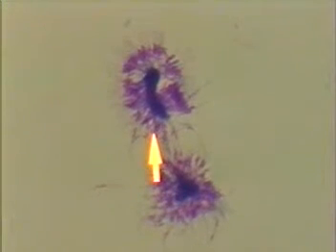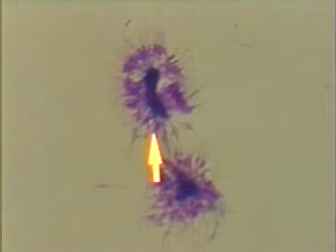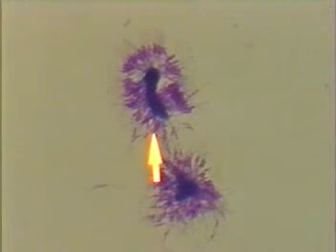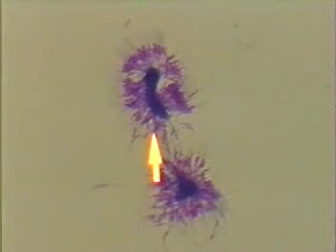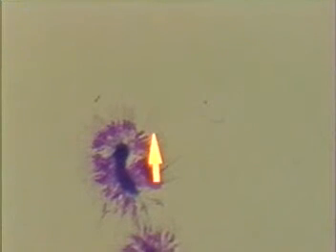Finally, if you look for a fairly long period of time and are very fortunate, you may stumble onto these structures. These are the sporozoite stage from Plasmodium falciparum, labeled the sporozoites of malaria. You can notice the long spindle-shaped structures that would come out of the oocysts in the stomach wall and progress down to the salivary glands. This slide was prepared by dissecting out mosquito salivary glands and then crushing and staining them.